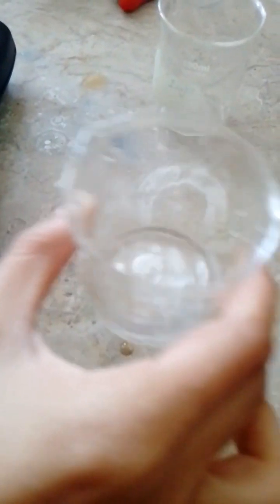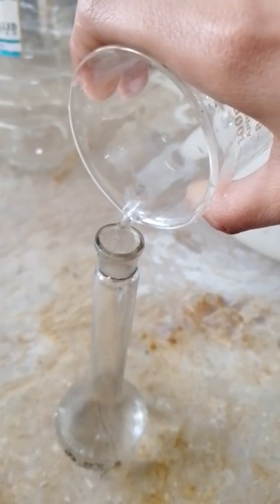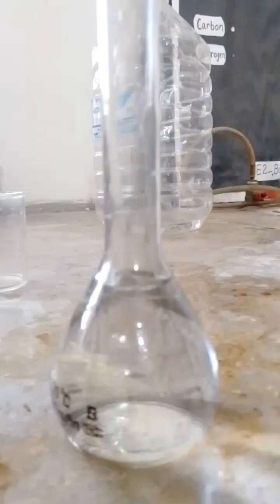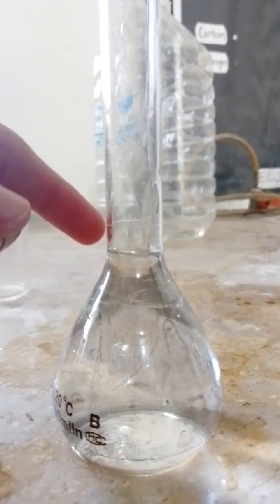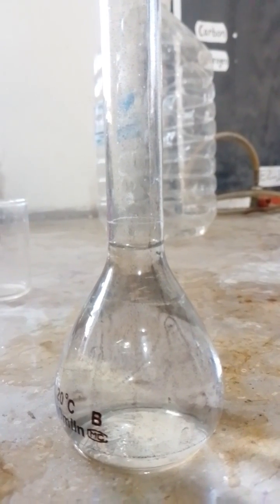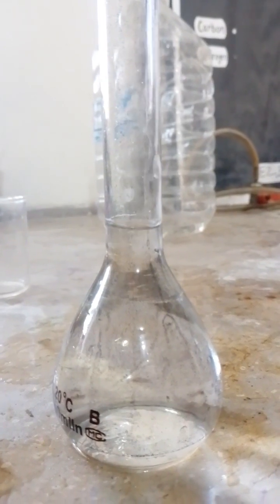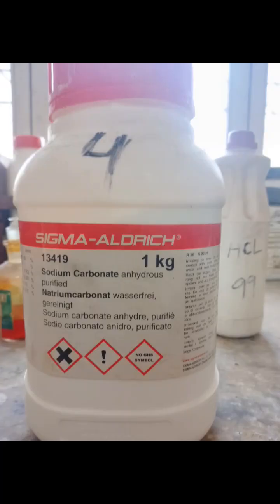After completely dissolving it, you will transfer the solution of salt into a 100 ml volumetric flask. Then you will add distilled water up to the mark. By this method, we prepared 0.1 molarity sodium carbonate solution.